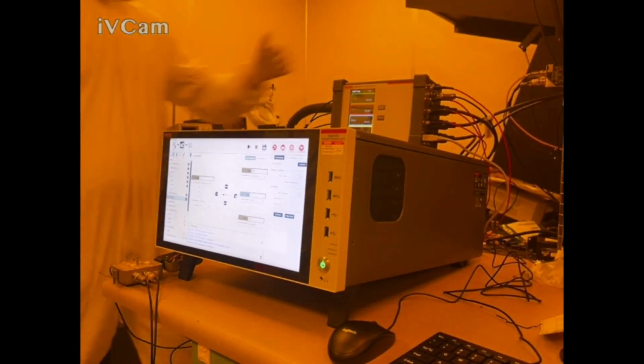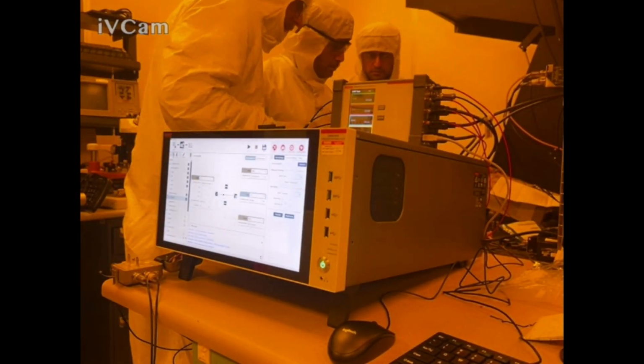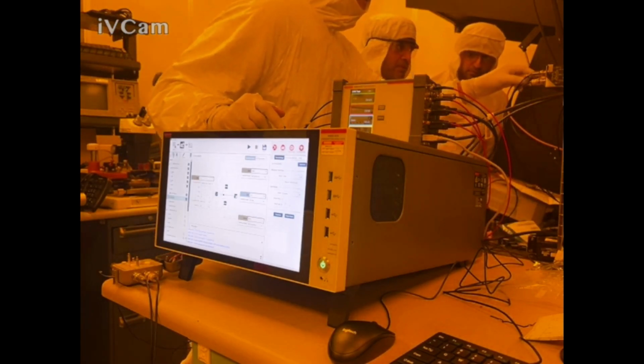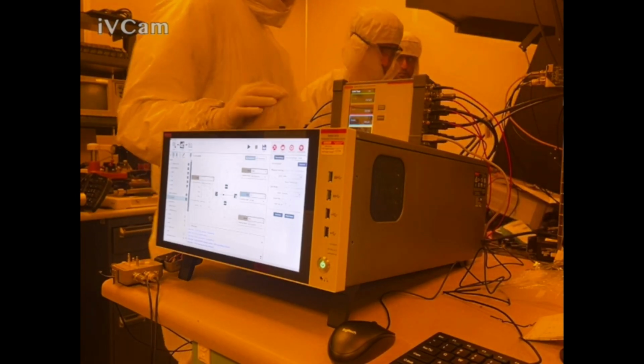One thing we could do, we could try it without this and see if it works. Okay. We need adapters for that. So you should have gotten adapters for this. The problem is we probably can't find it, right? SMA to BNC, and then you need BNC. We're not going to have all this stuff. There's no way. There's one adapter I see. This one? Yeah, that's one of them. No, this is it. We need two of those. What adapter do you need? SMA to BNC. There's one here. And then we need BNC to triax, and then we need SMA to BNC.